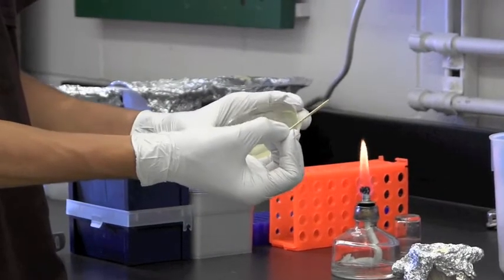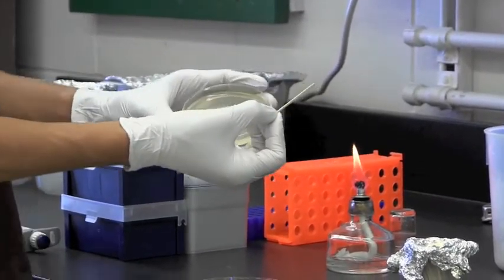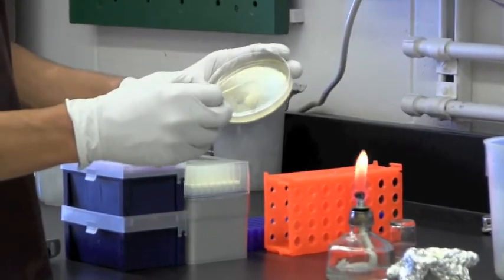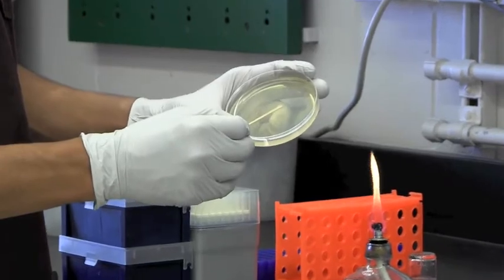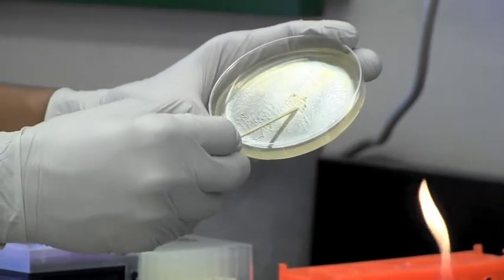And carefully you want to patch your isolate onto a small area of your spread plate.